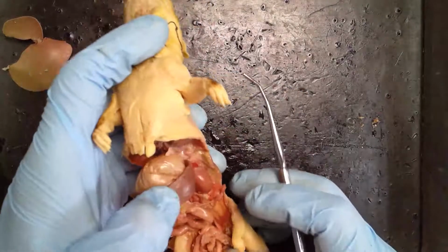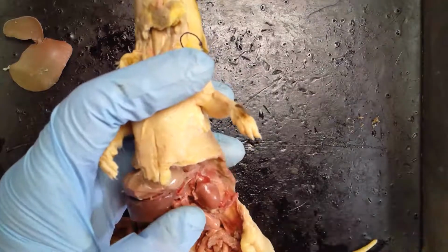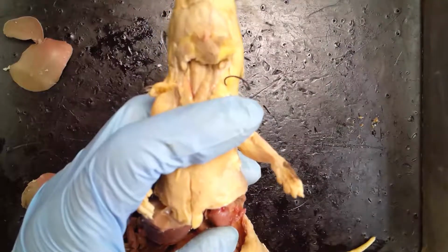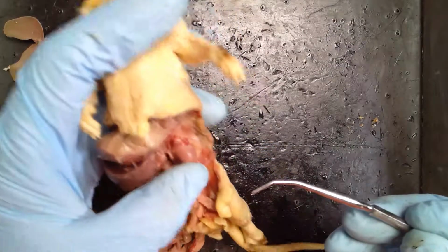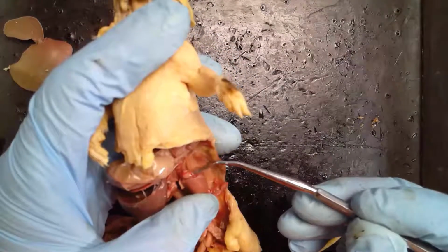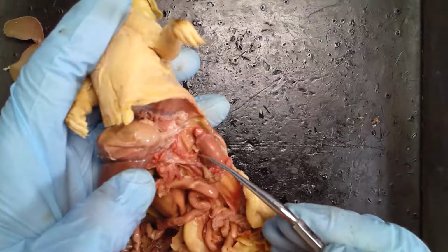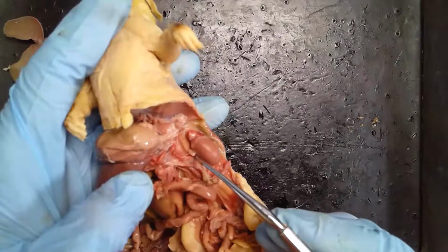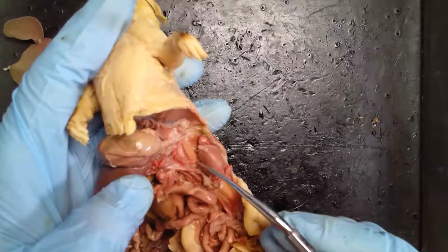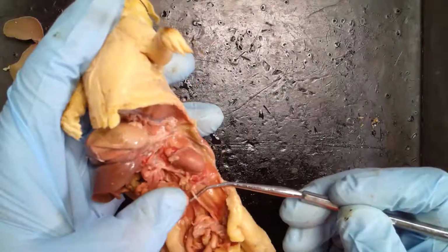I've actually loosened up the kidney a little bit better on the other side, so we can see it here. If you take a look at this, you can see the adrenal gland. Whoops, is that on camera? The adrenal gland right there on top. And we can see the arteries going in to the kidney, and there should be veins leaving it. And I thought I had the ureter. Here's the ureter on this side. Okay?